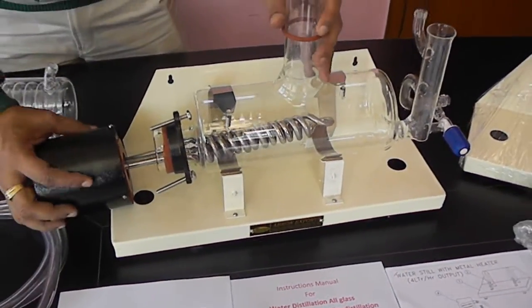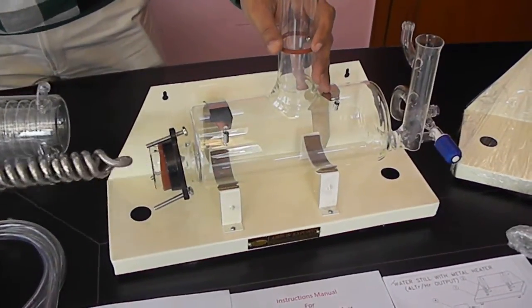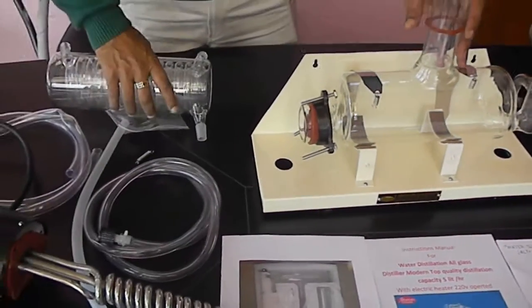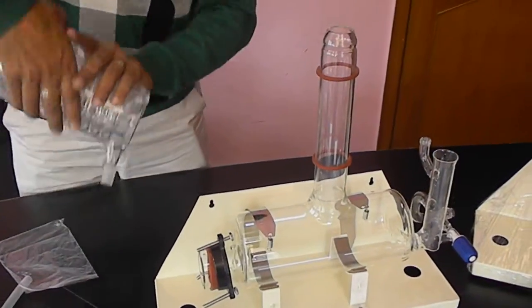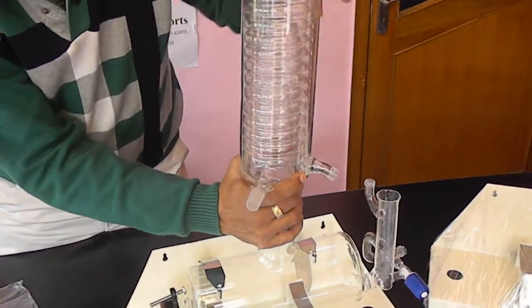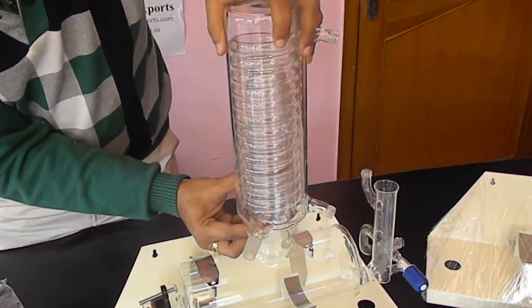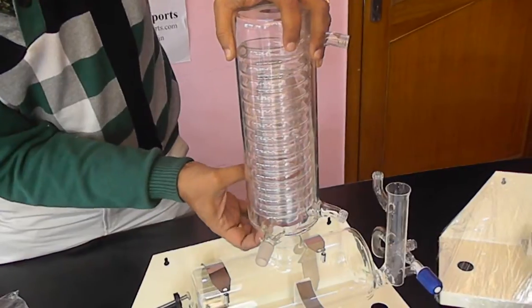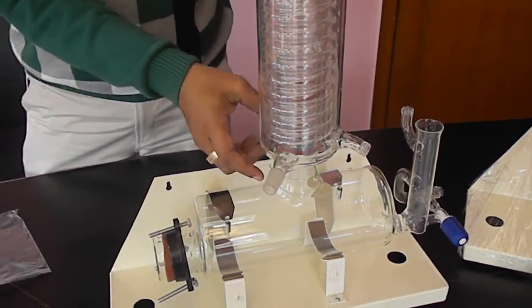Then there is one condenser. This condenser has rubber tubes. We will put this on the rubber tube, slide it slowly so that these rubber gaskets are secured and there is no leakage.